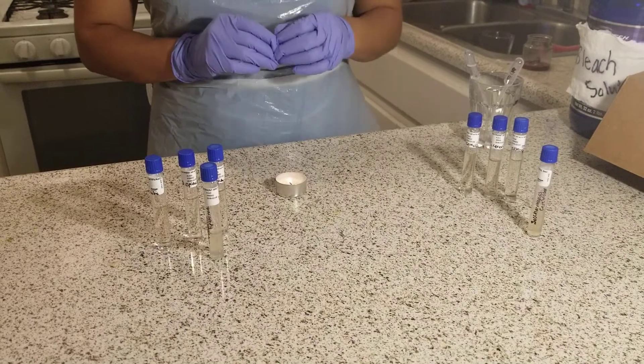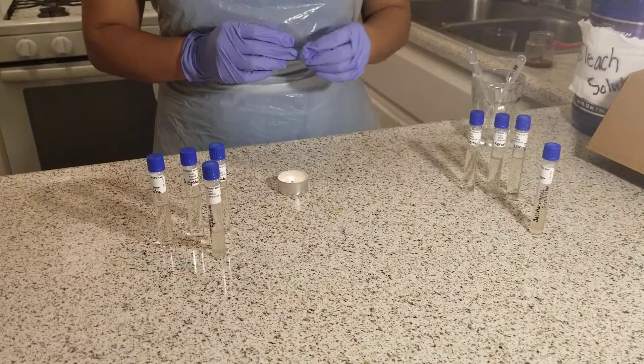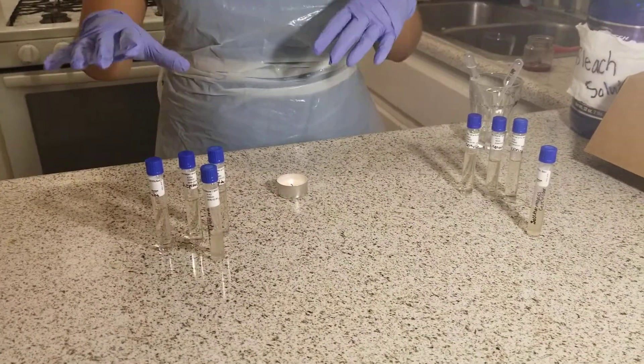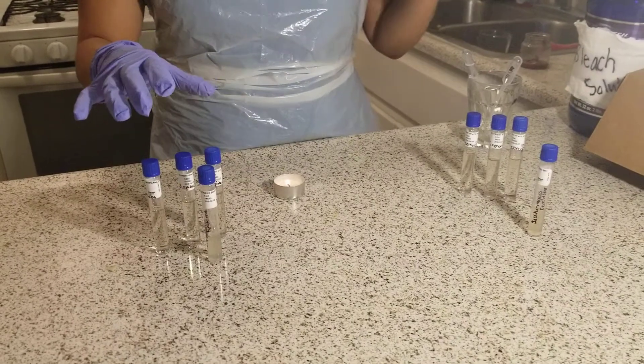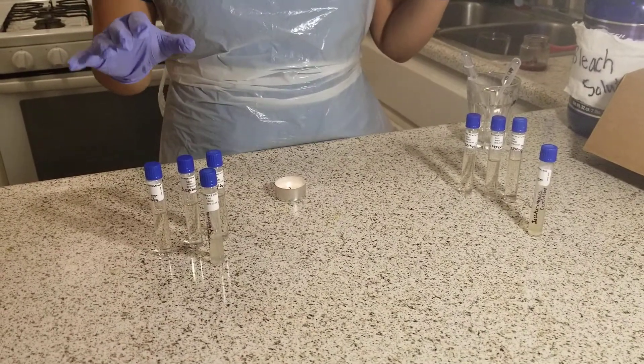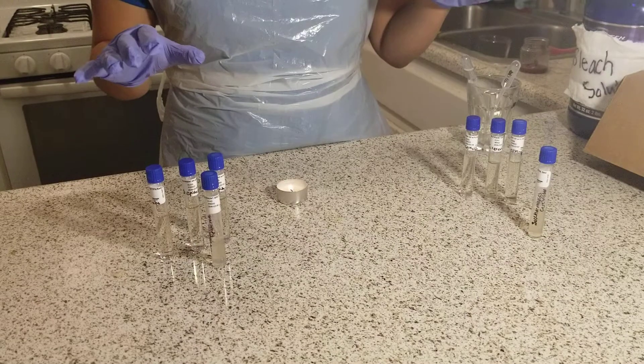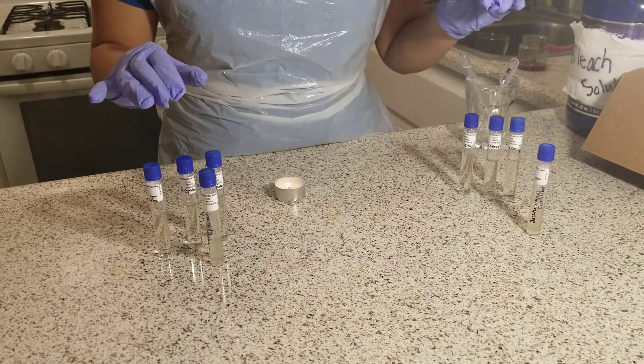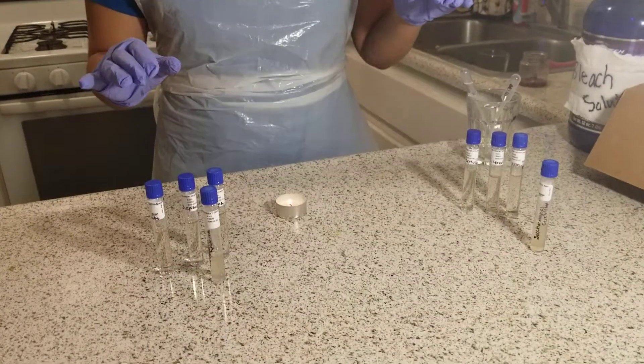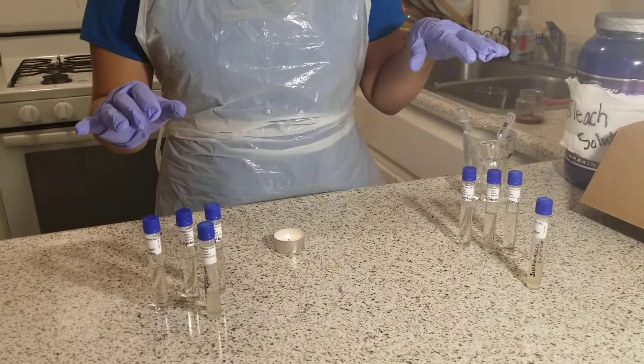In this lab, I will be incubating S. cerevisiae and S. epidermidis culture broths containing differing salt concentrations to determine an approximate osmolarity range for each microbe.